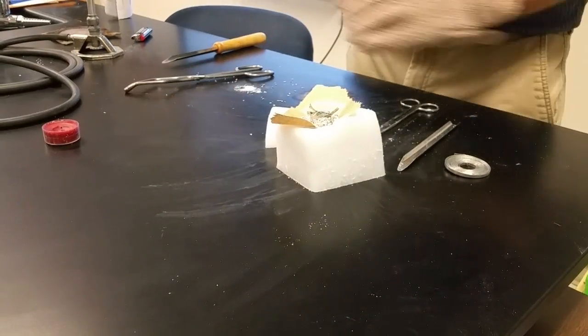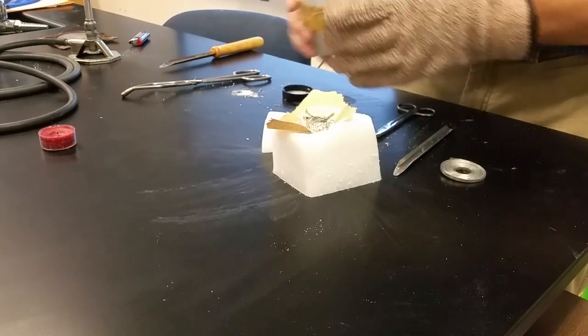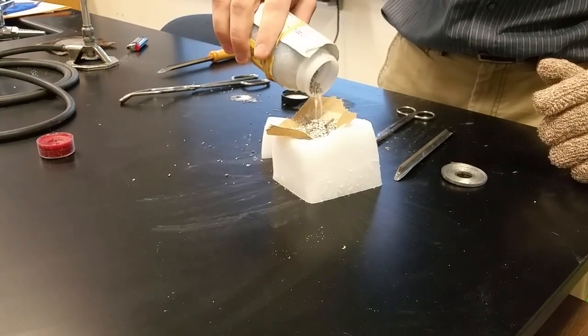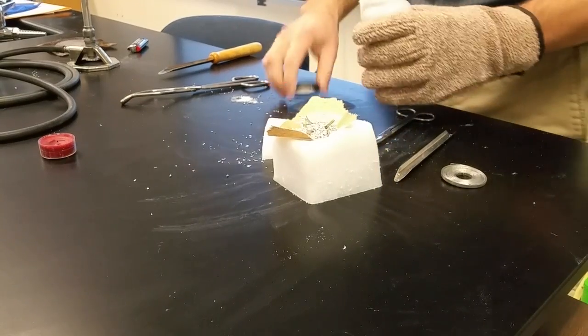So, you know what? Can't hurt to have too much, right? What's that? Magnesium flakes. It's a lot of magnesium. Yeah, it is!